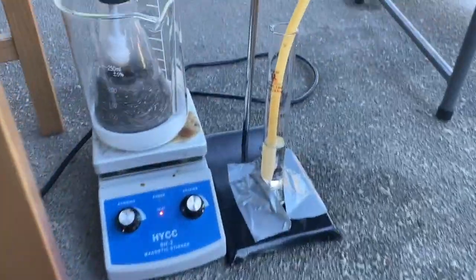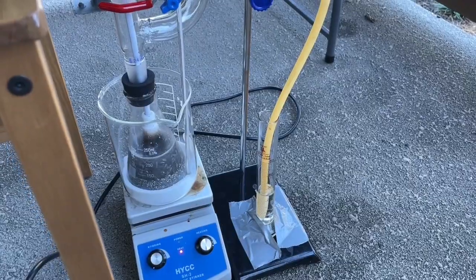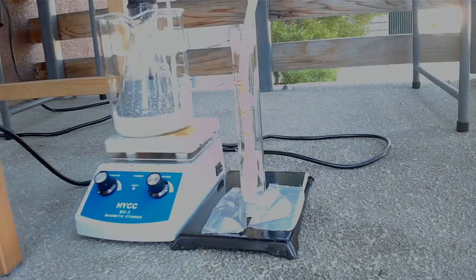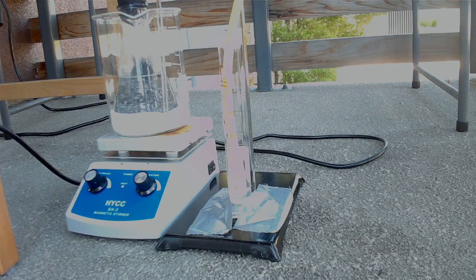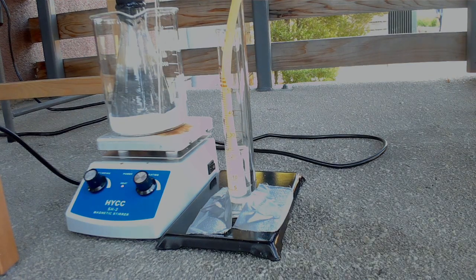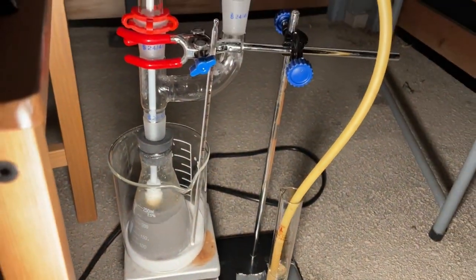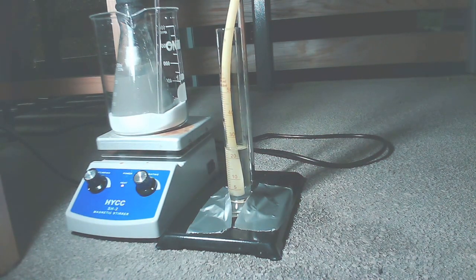Next, I turned on the heating and stirring. After about 10 to 20 minutes, the temperature had risen to about 50 degrees Celsius and bubbles had started to be produced at about a one bubble per second cadence. In this part of the reaction, the remaining moisture is probably reacting with the sodium to produce more sodium hydroxide. After about 3 hours, the sand bath had reached the target 200 degrees Celsius, the bubbles were a bit more vigorous, and the reaction mixture had started to turn into a grey slurry. At this point, I let the reaction go overnight.